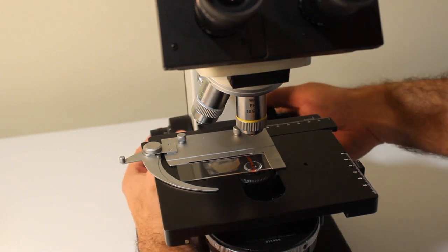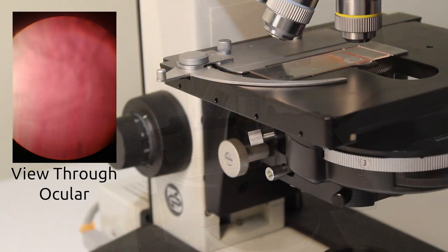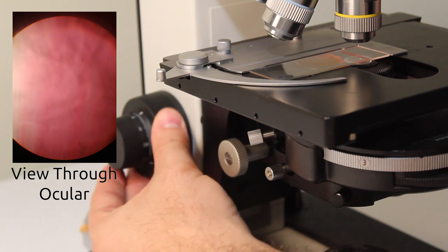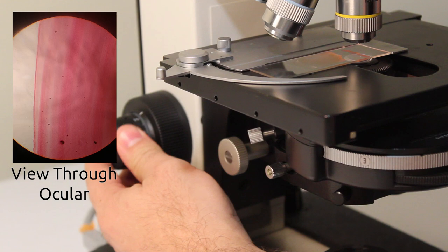Now, while looking through the eyepieces and turning the focus knobs, I want to bring my sample up until focus, basically looking through the eyepieces to see when that sample is actually in focus.